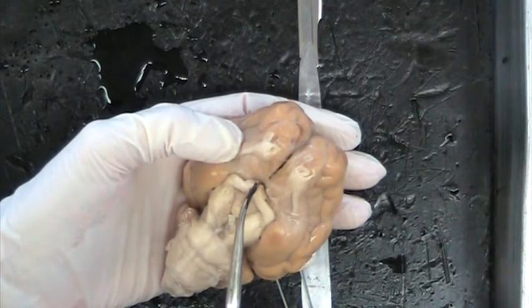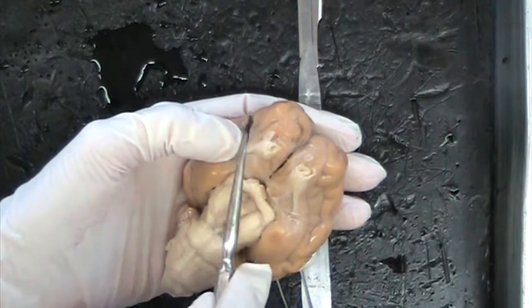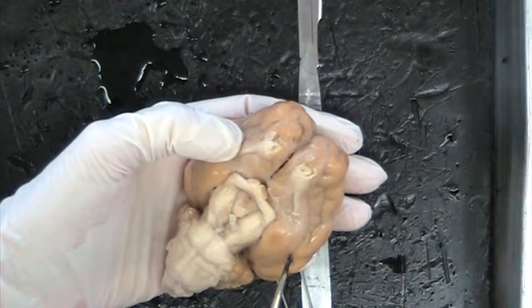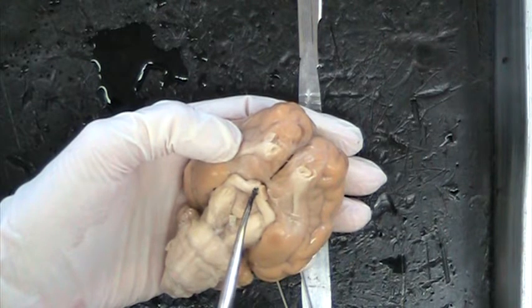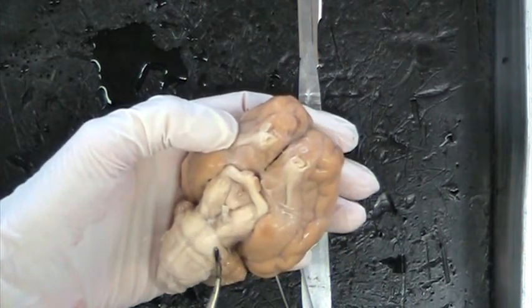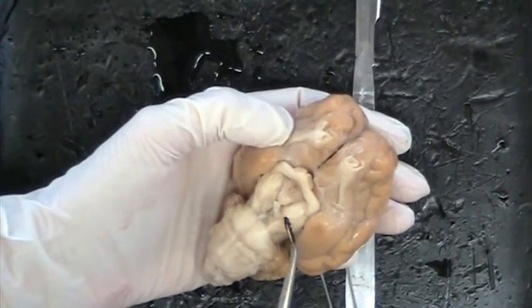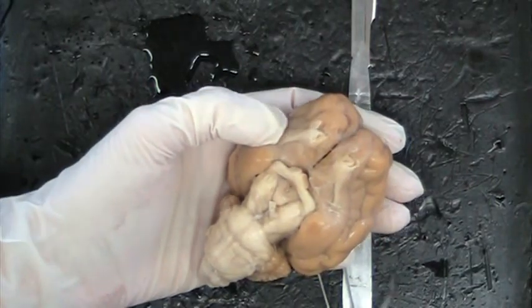There's a U shape in between the optic nerves called the optic chiasm. And of course we already know that a lot of what you see with one eye is processed on the other hemisphere of the brain, and that's why the optic chiasm is important. Then if we come back a little bit here, you have trigeminal nerves and your facial nerve. You don't have to worry about the nerves in here for now, but this is where a lot of the nerves are on the base of the brain.